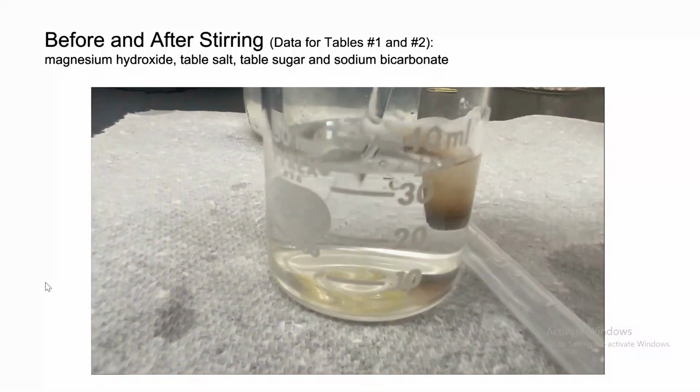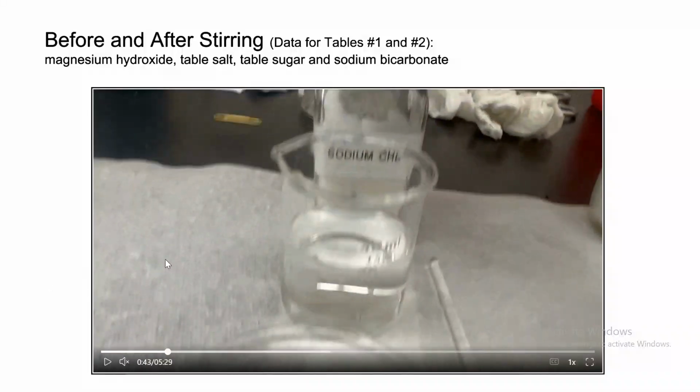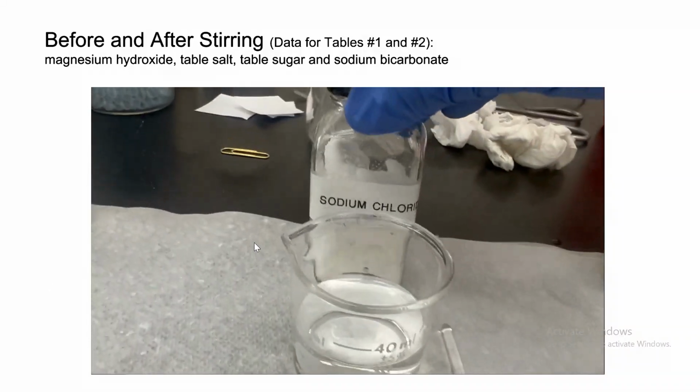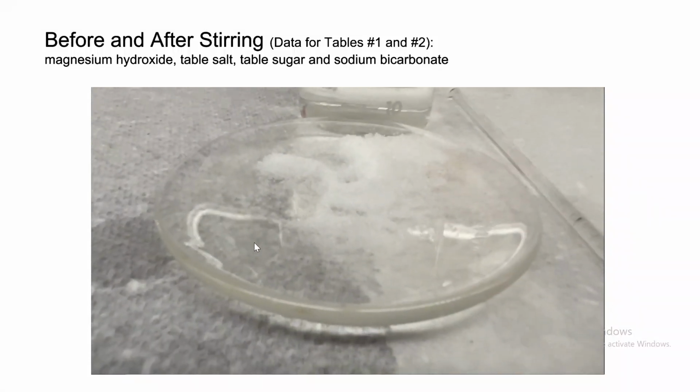And look, we're trying to mix it. Does it mix? Yes. So you're gonna write mixes. So you're gonna write dissolves and soluble. Now let's look at sodium chloride, which is table salt.